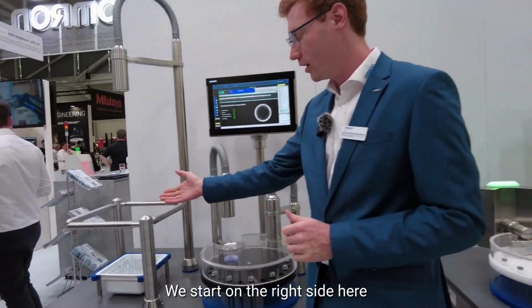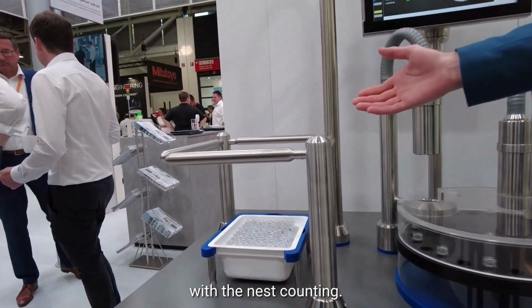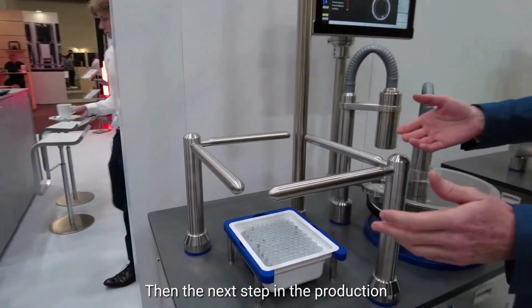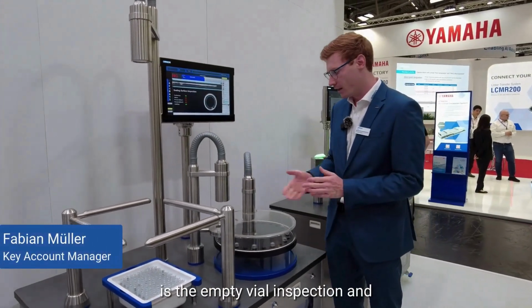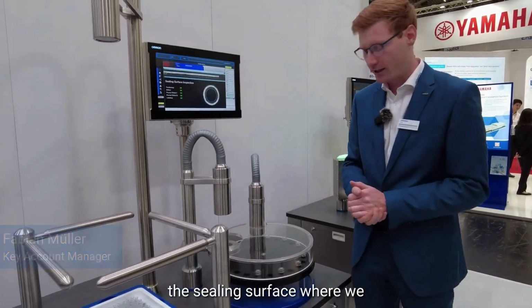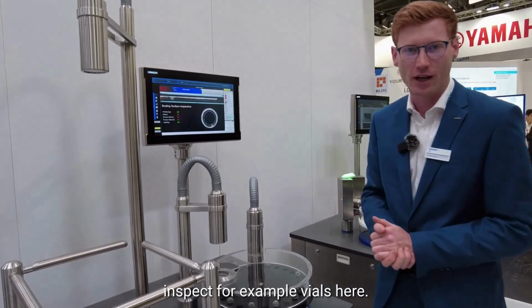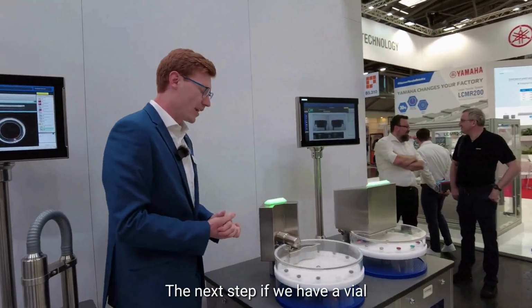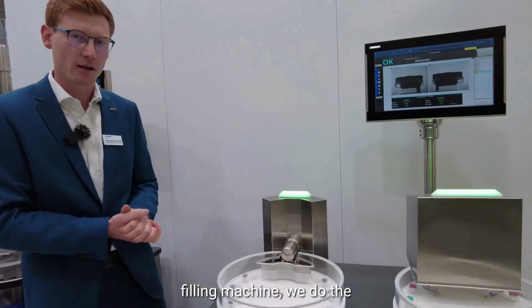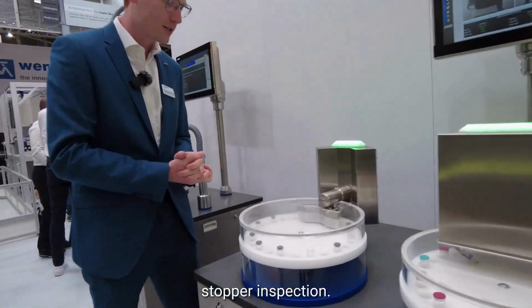We start on the right side here with the nest counting. Then the next step in the production is the empty vial inspection and the sealing surface, where we inspect, for example, vials here. The next step, if we have a vial filling machine, we do the stopper inspection.